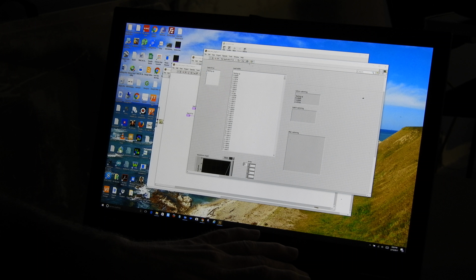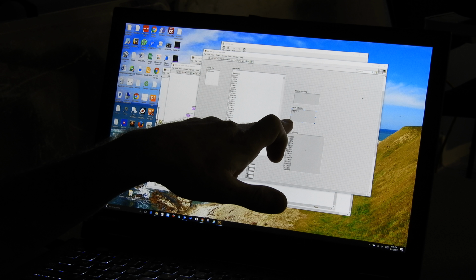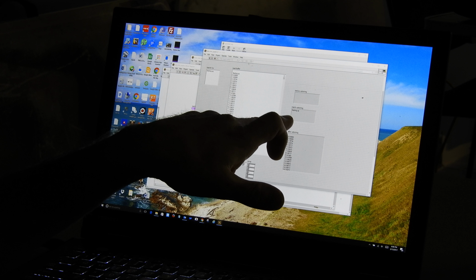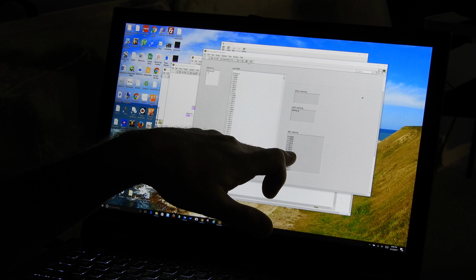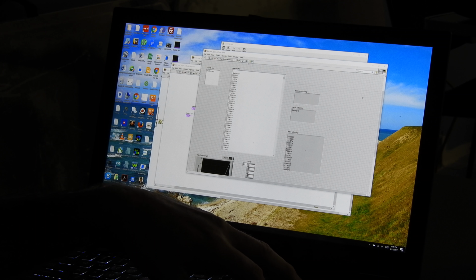I'll save it. I mean, is it making sense what I'm doing, or am I moving too fast? Okay, now I got it back. Okay, look, it got rid of it. For some reason, the first time I ran it, it didn't run right. Now it's running properly. Oh no, I still have that carriage return. I'd like to get rid of that carriage return. Tell you what I'm going to do. See, can we even go down to that point? How are we going to get rid of that value there, that extra carriage return? I tell you what, here's what I'm going to do.